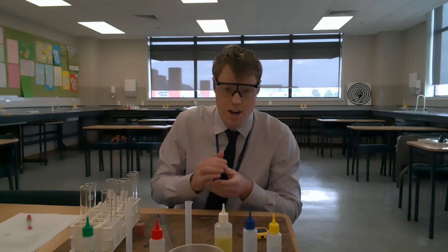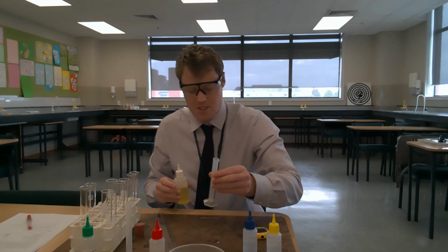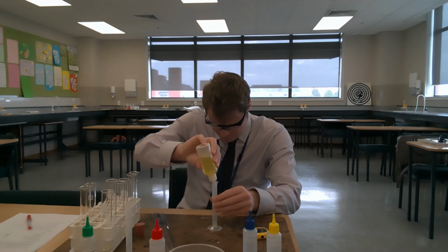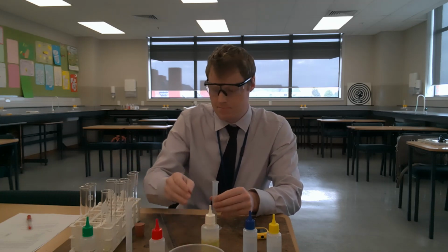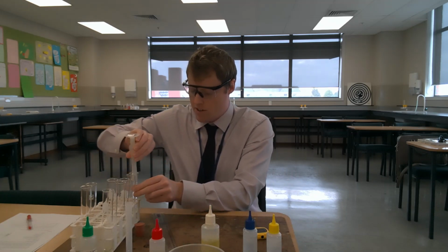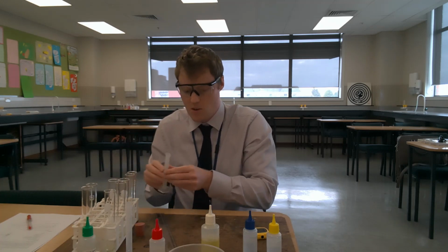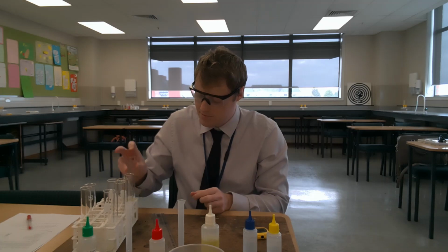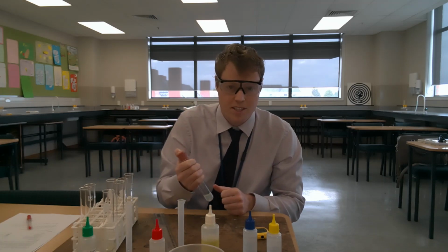Let's do trial 1 for potassium chloride. So I'm going to take 1 milliliter of soap, pour it into the potassium chloride solution, place the bung on, then using my stopwatch, I'm going to shake it for 30 seconds.